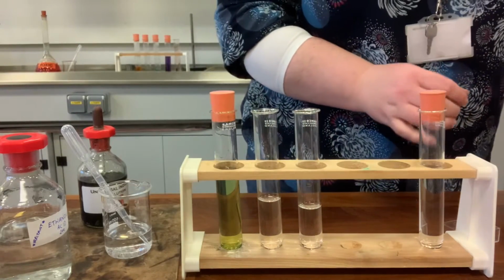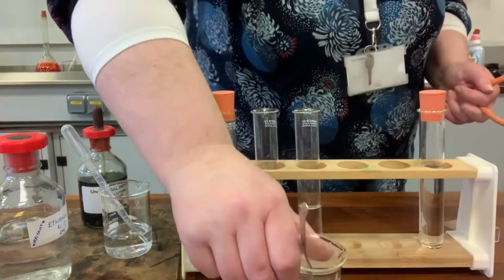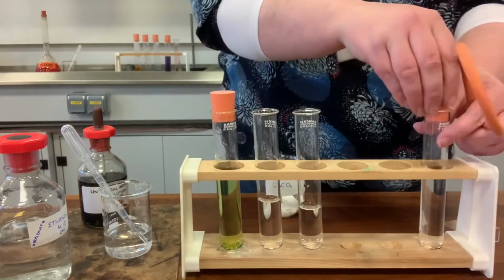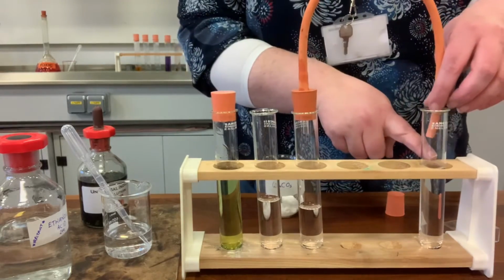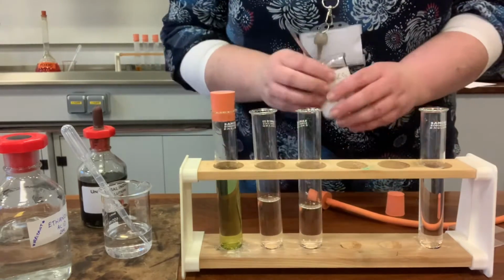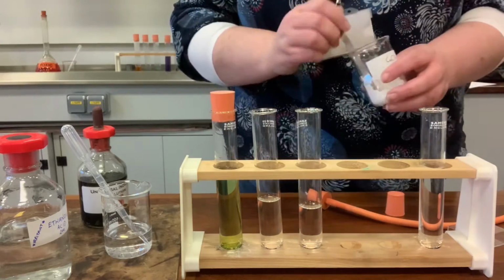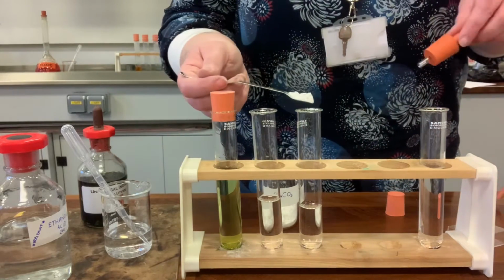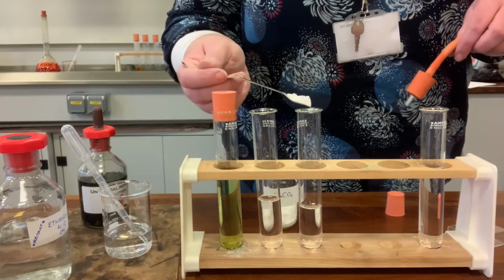Okay, so our next reaction is when a carbonate is added. What I've got here is a beaker with some calcium carbonate in it that I'm going to add to the test tube of ethanoic acid, and the bubbles that it produces, I'm going to put into this test tube that has lime water in it. Hopefully you can remember from Unit 1, the test for carbon dioxide is that it turns the lime water from colourless to cloudy. So let's just see, we'll add a little spatula full of calcium carbonate. A metal carbonate plus an acid gives you a salt plus water plus carbon dioxide.